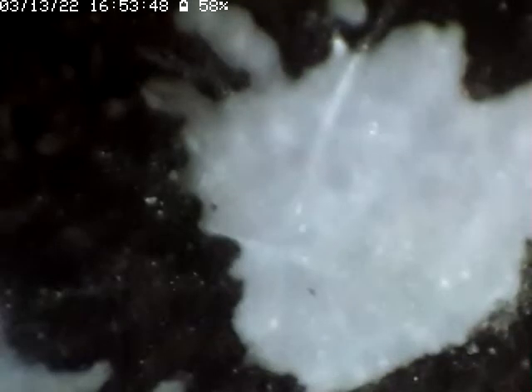This is hand movement, not from the microscope mechanism. So we're using the mechanism now because it's easier. It's the letter A, as you can see, and we can go to a higher magnification, but the color is still blue.